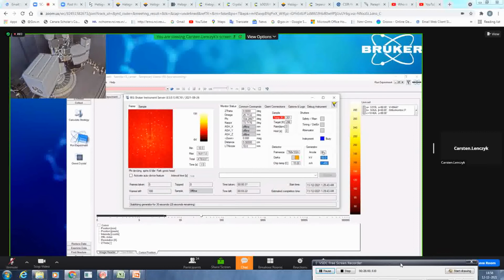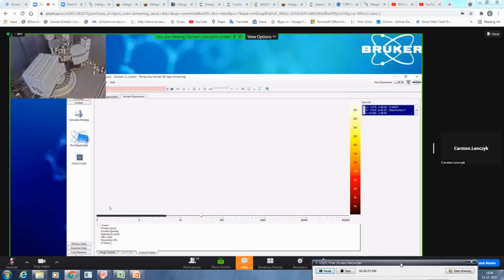Currently, we're using molybdenum. And as you can see here, it is ramping and stabilizing. The goniometer position is at this position right now. Since we don't attach the automatic goniometer head, this is assigned as offline, and we do a room temperature measurement. So the cryostat is attached, but it is not active right now. So it is done stabilizing, and in a few seconds, it will start the measurement.